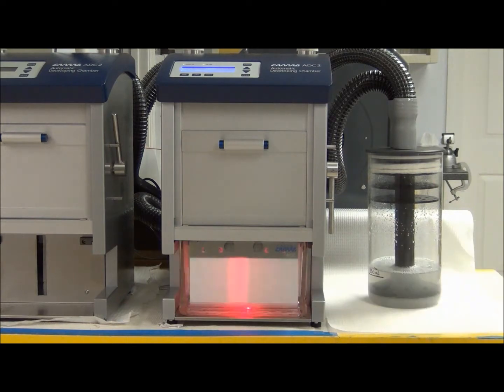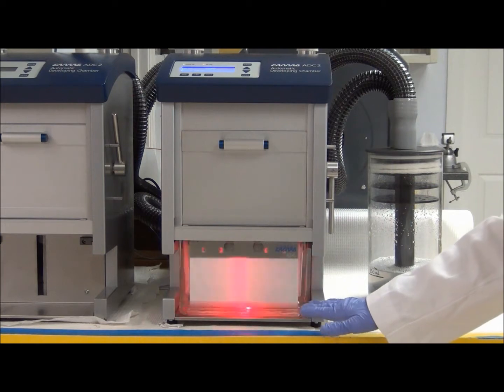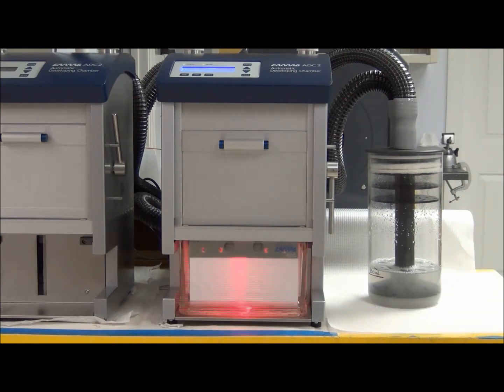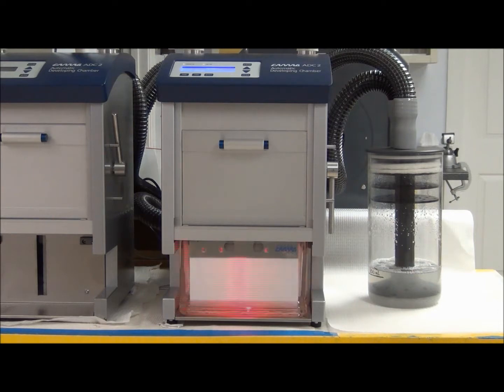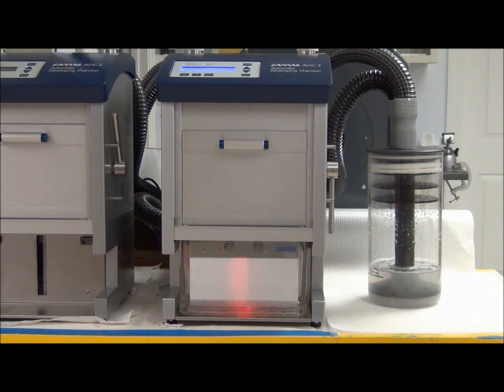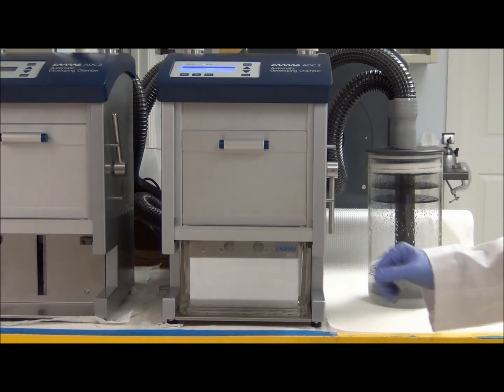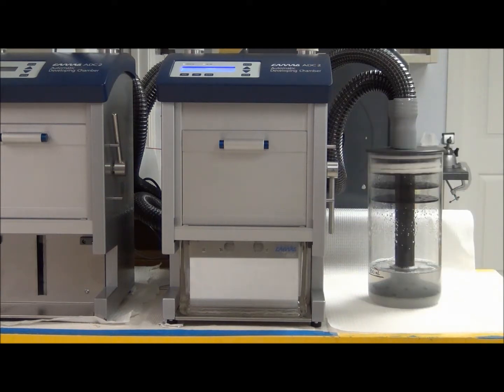The flashing red light you see is the CCD monitoring the movement of the solvent front as it moves up the plate. It will continue to monitor that solvent front movement until it reaches the desired distance, which in our case and in most of our methods is 70 millimeters from the bottom of the plate. Once it reaches that level, the plate will be removed, dried, and then we can remove it from the ADC2.